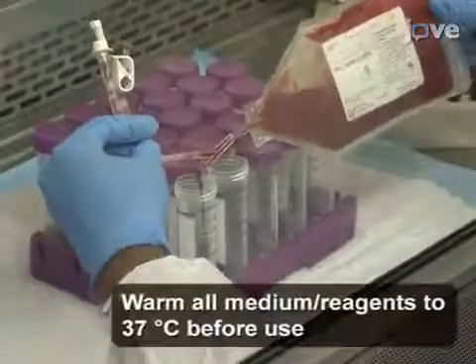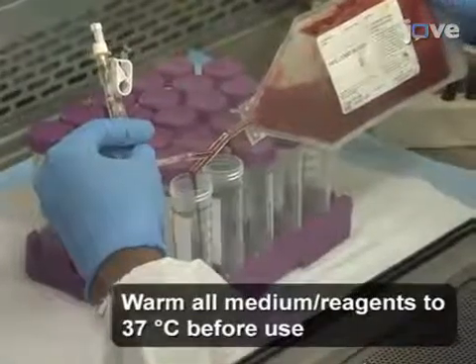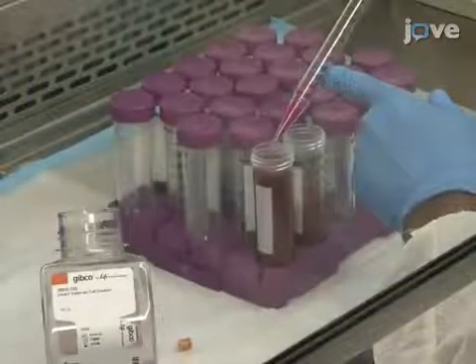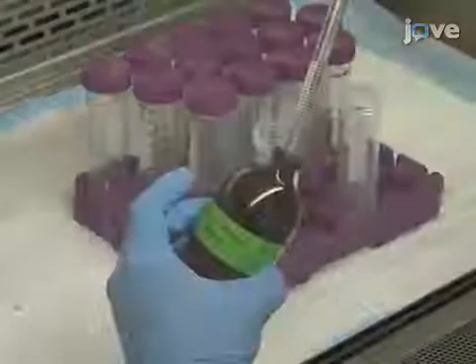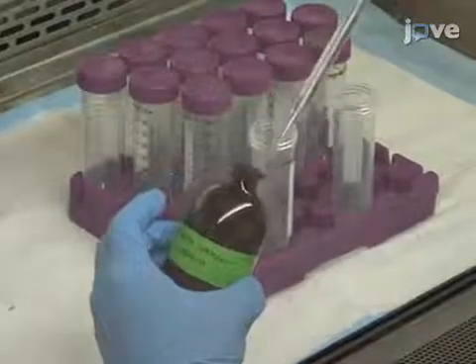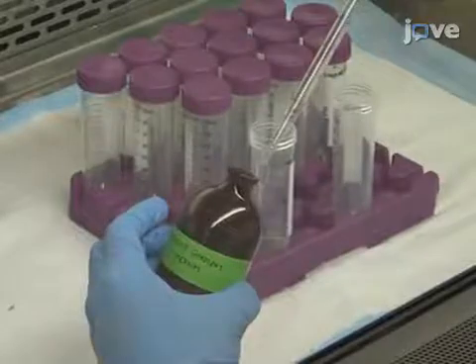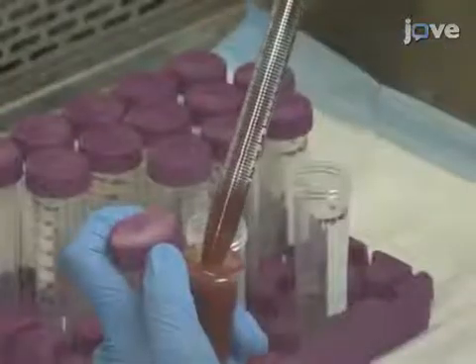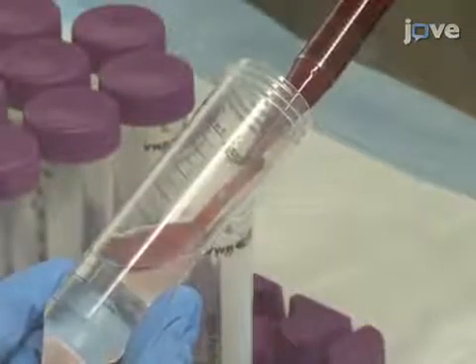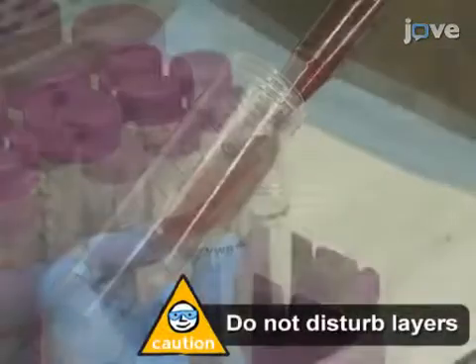Then dilute approximately 25 milliliters of cord blood with HBSS at a one-to-one concentration. Next, add 20 milliliters of density gradient medium reagent to a 50 milliliter conical tube and carefully dispense 20 milliliters of diluted cord blood down the wall of the tube to layer the blood onto the medium.